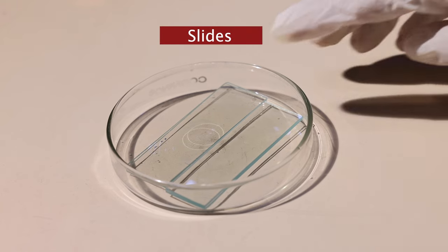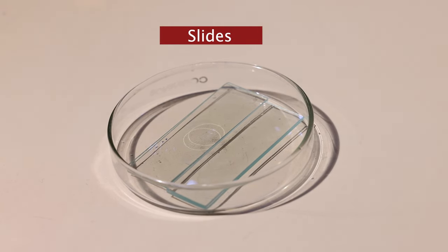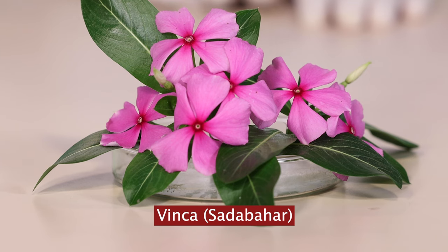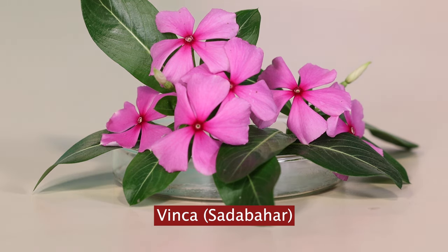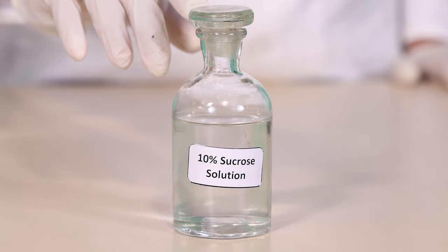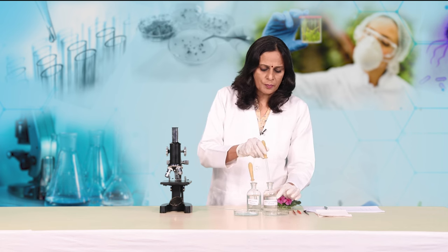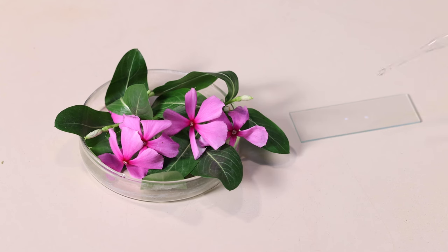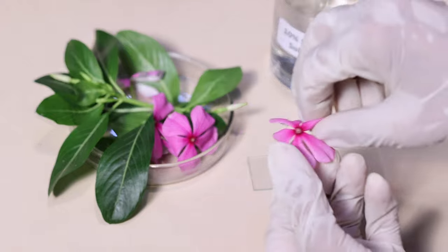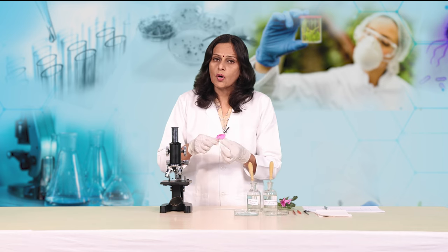Let me explain the procedure. First, we are going to take a cavity slide which should be clean and dry and place it onto the table. Then we will take the flower of Vinca rosea because we need to dust the pollen grains onto the slide. First, let me pour a drop of the pollen germination medium. We are going to use separate droppers for each solution. I will pour just one drop of pollen germination medium onto the cavity, and then take the flower to dust the pollen grains onto this drop of germination medium.